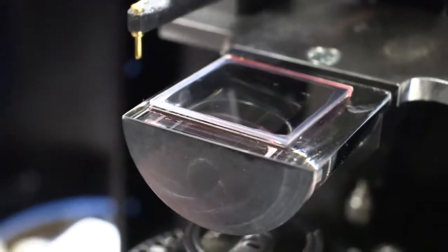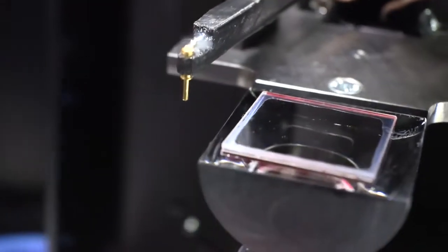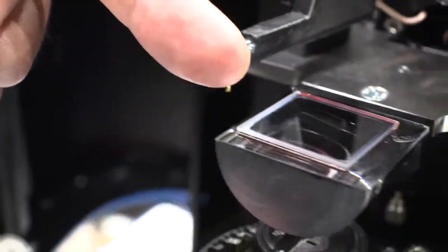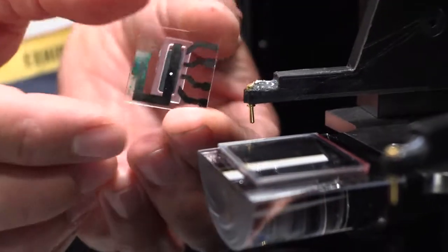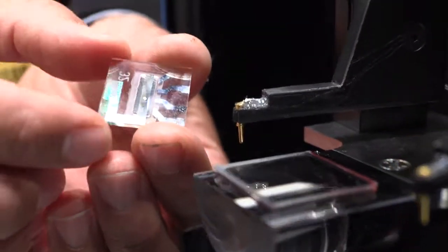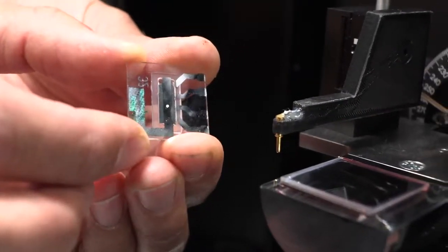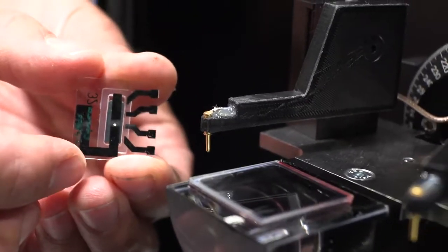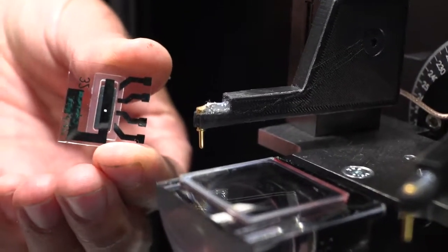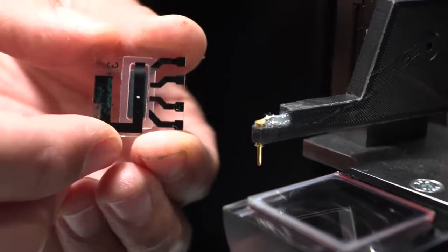So this is part of an OLED display? Or pixel? What do you say? Yes, this is a large area film. This film that looks transparent will then be used in an OLED. This is now a research OLED pixel. There are a few OLEDs here inside, just 4 of them. It's not a high resolution display, it's just made to improve and optimize an OLED stack. OLED stack means there are thin films of OLED materials that make up the OLEDs.